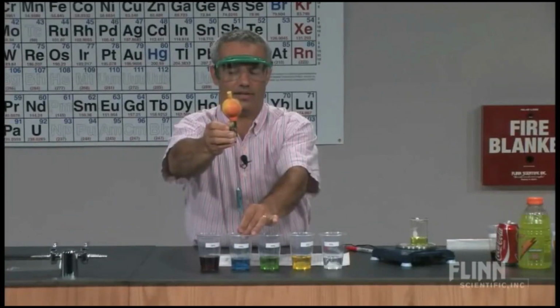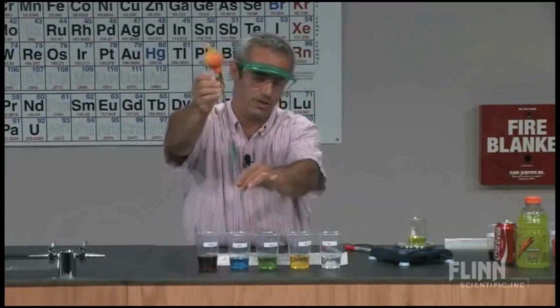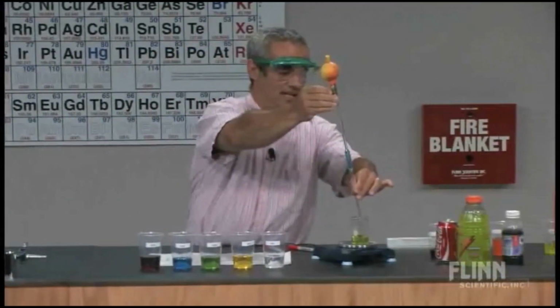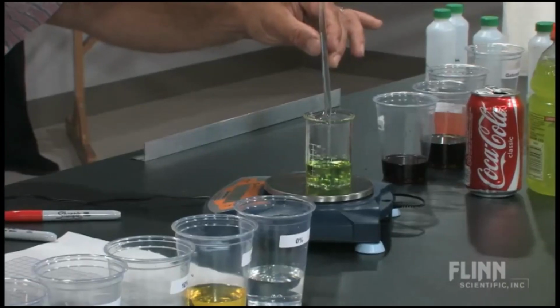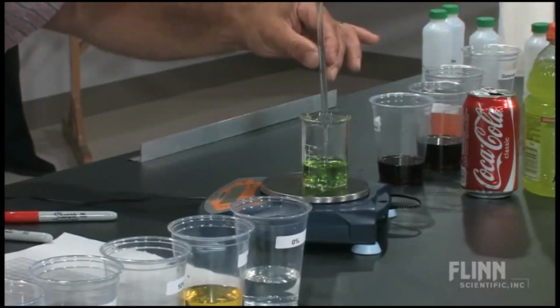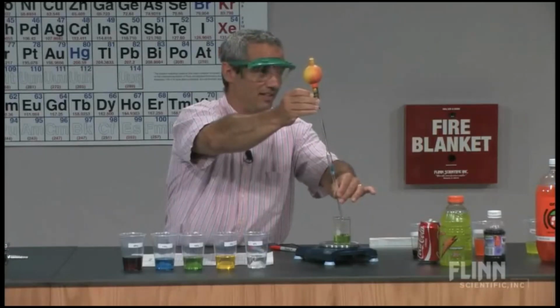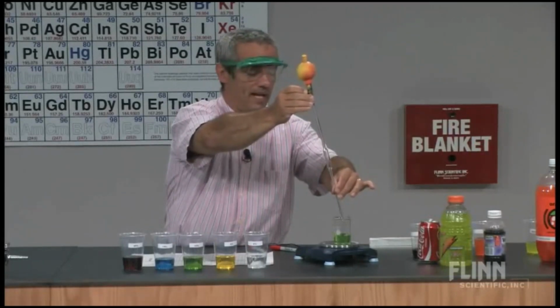I could have done this all ahead of time and just written down the data, but I think it's more important you see this thing does work. Okay, here's our 15%. And you know what I forgot to do that time? I forgot to zero it. That's okay, because we know what the last one weighed. I'm just going to subtract it. Okay? It certainly isn't as though I have to start all over again.